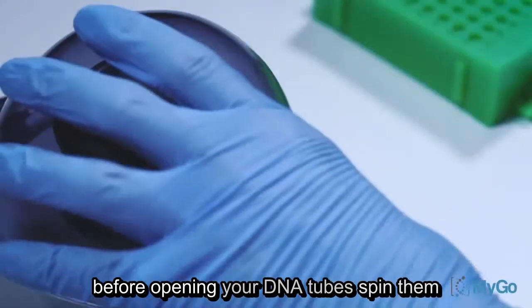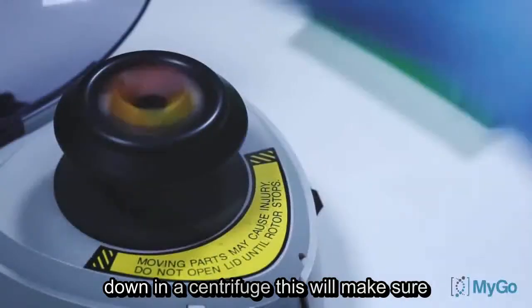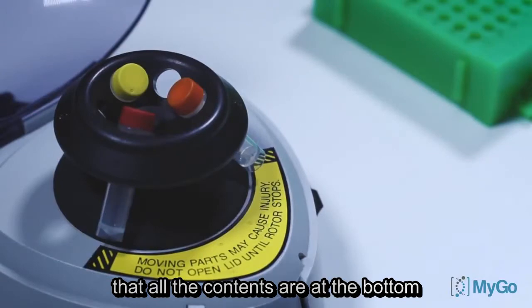Before opening your DNA tubes, spin them down in a centrifuge. This will make sure that all the contents are at the bottom of the tubes.